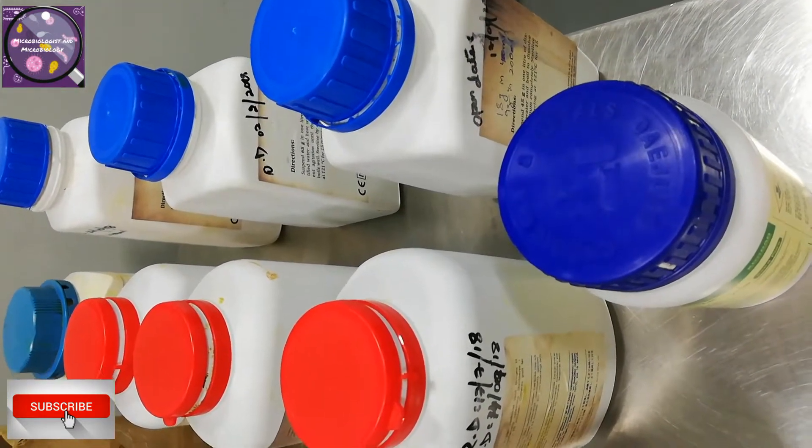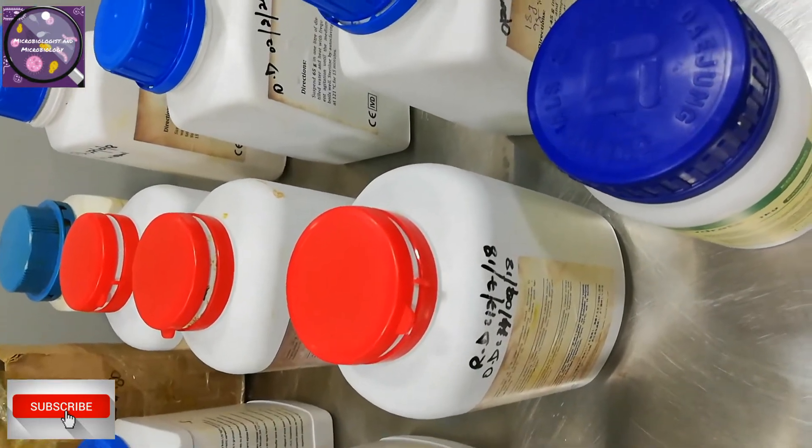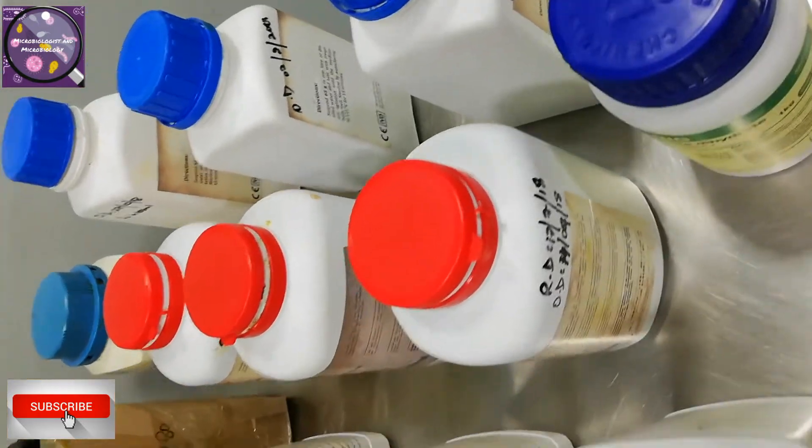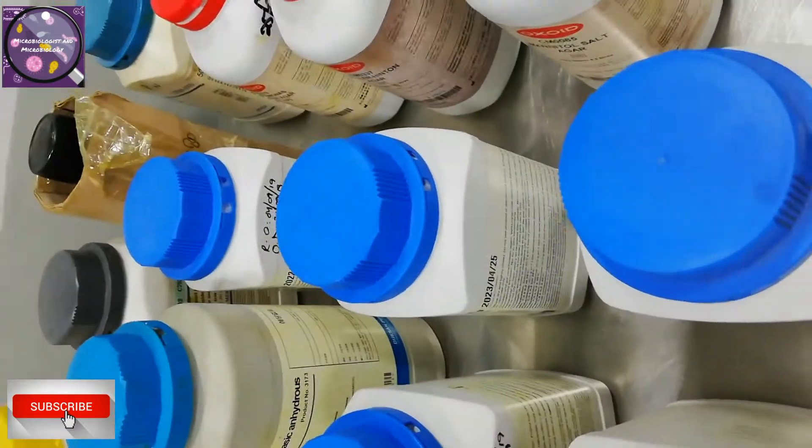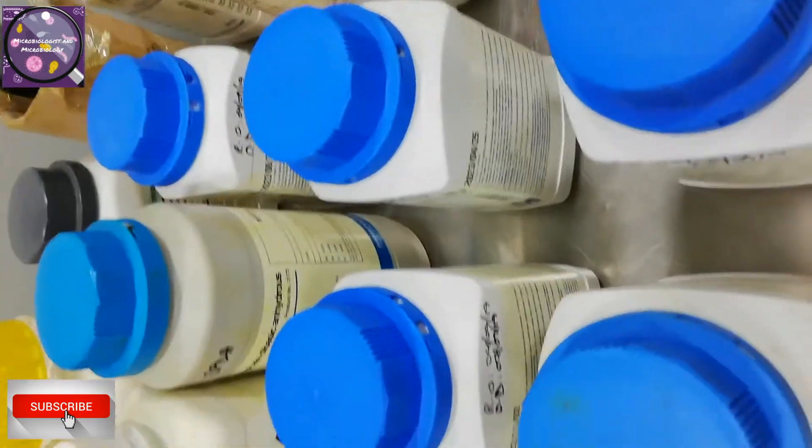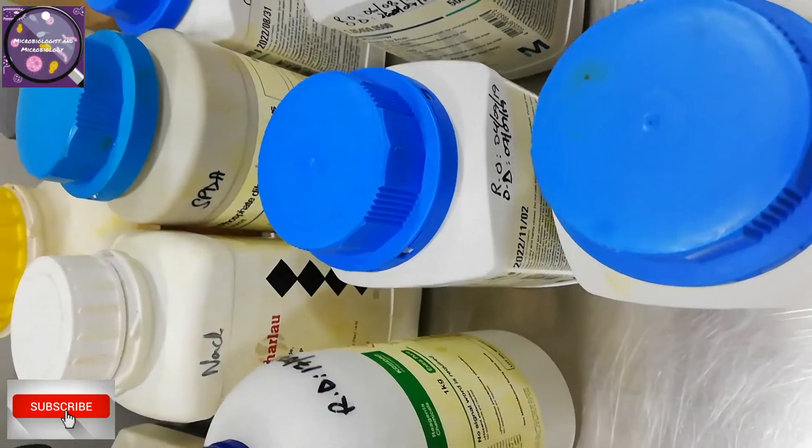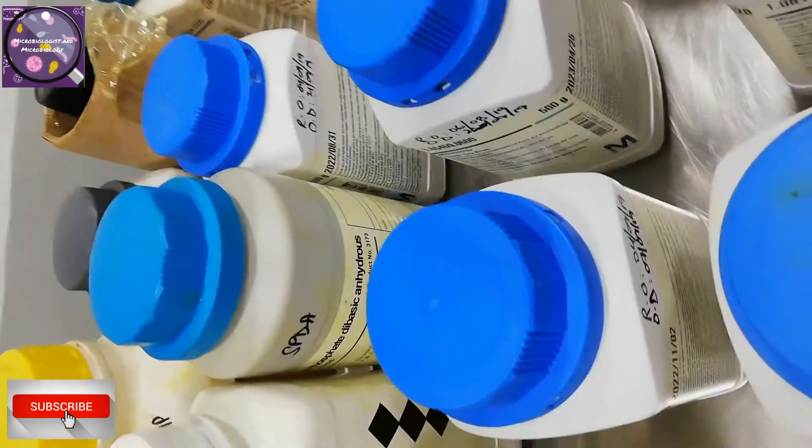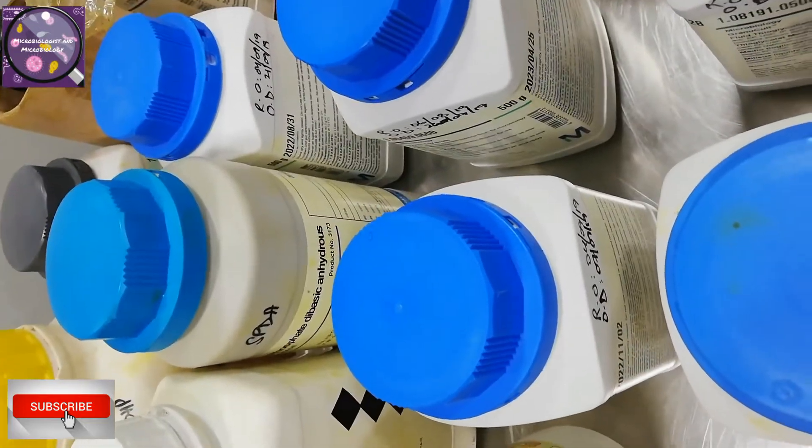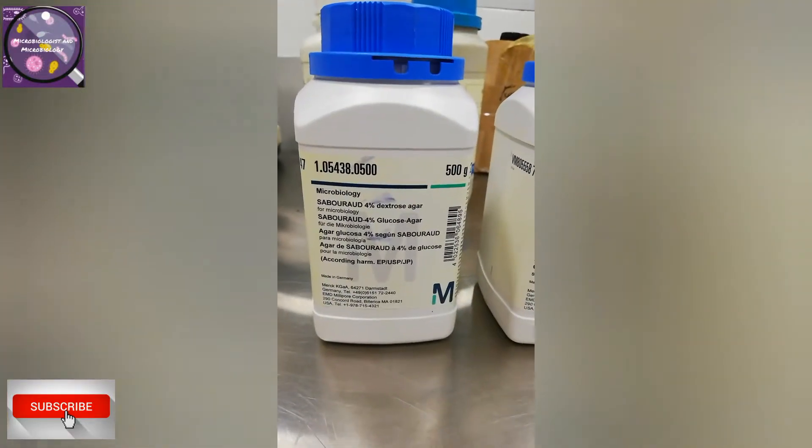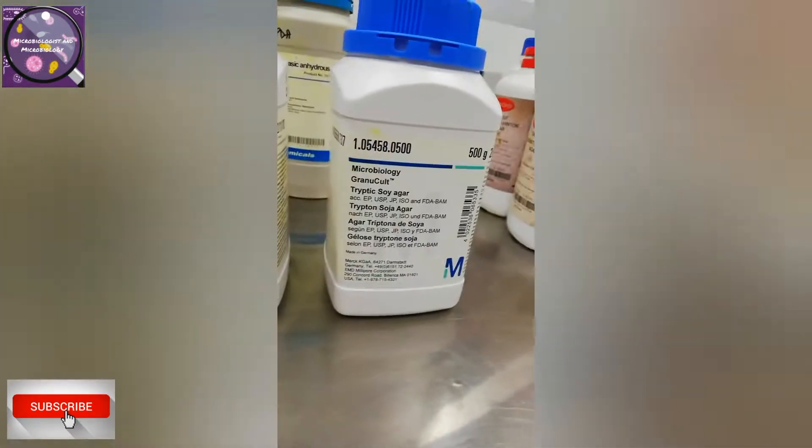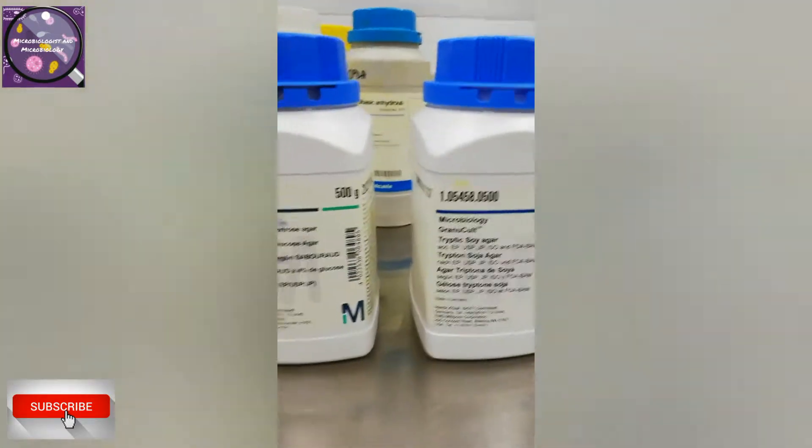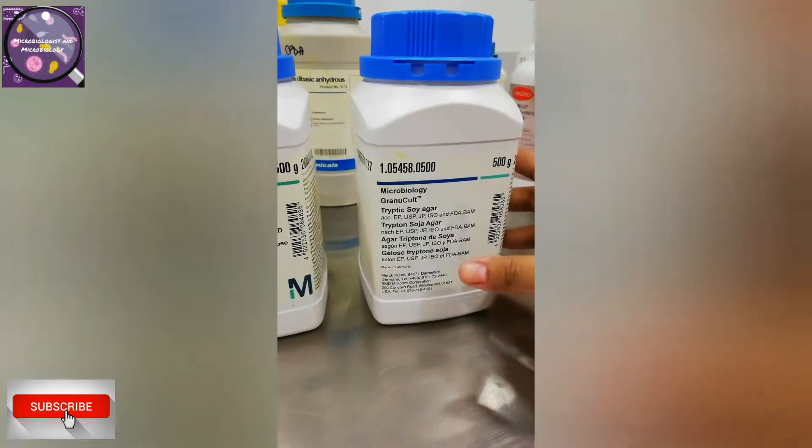As a microbiologist in different industries and clinical labs, we prepare media through ready-made dehydrated media whenever we are planning to do tests or procedures. It is less time consuming because we don't have to measure accurate ingredients separately. There are famous brands available in the market like Merck and Oxoid, but we are not here to promote any brand. We are here to share normal routine for media preparation through dehydrated media.